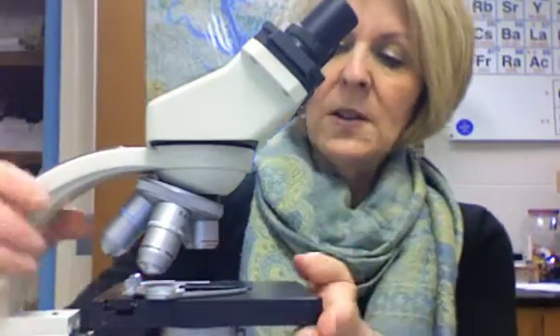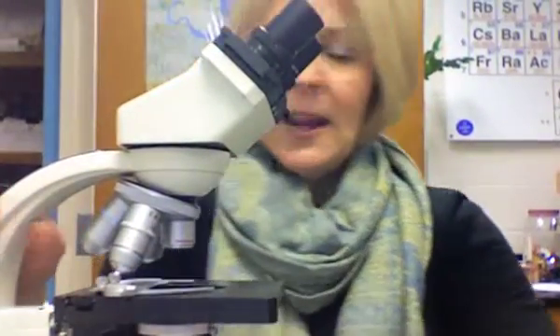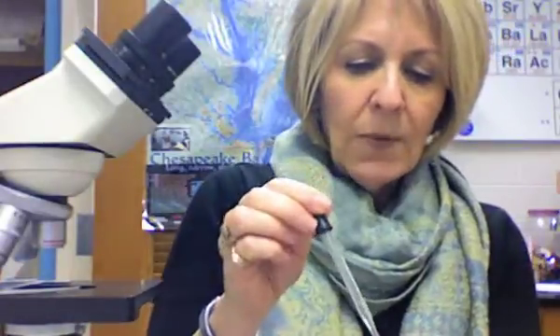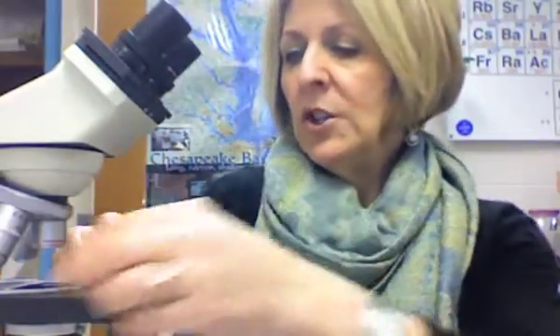This particular microscope is also nice because it has a mechanical stage. I'll make a quick detour to talk about making a wet mount slide. To make one, take your specimen — like a hair — put it on the slide, add a drop of water on the specimen, then take a cover slip and at a 45-degree angle lower it down. That makes your wet mount slide.